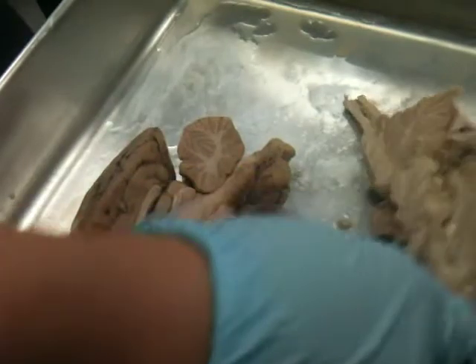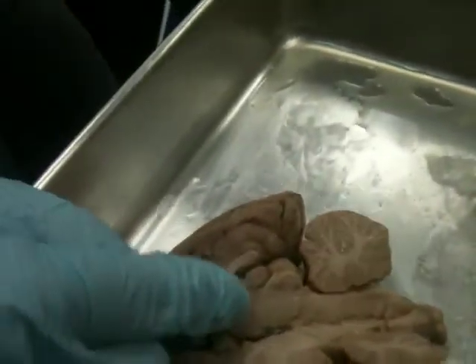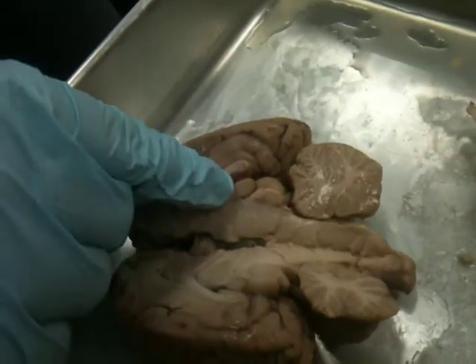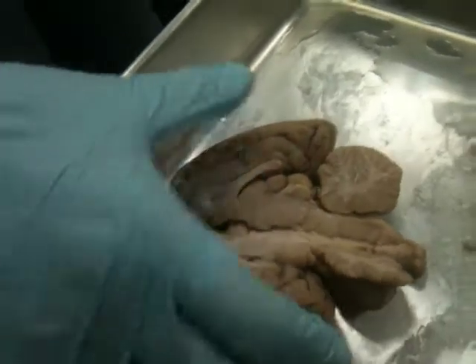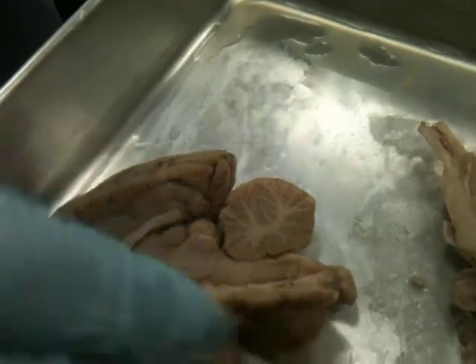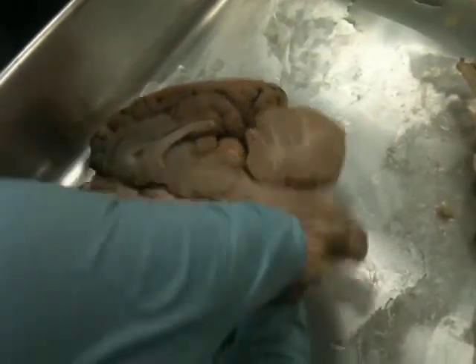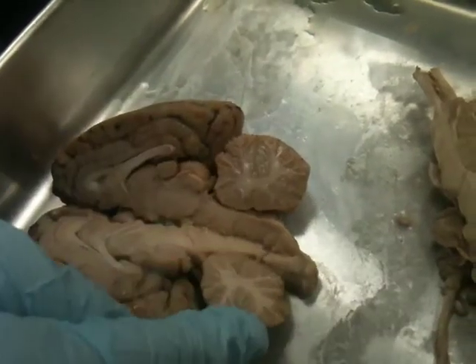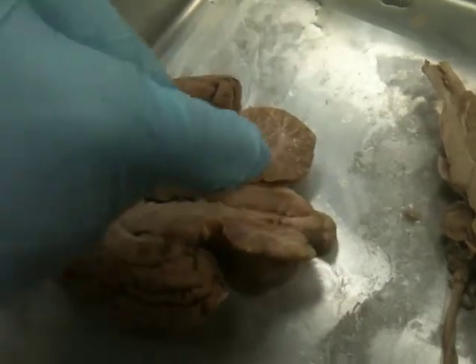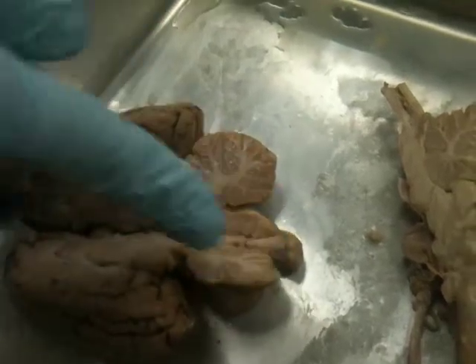So where was the pineal gland again? So the pineal gland, if you look on here, here's the thalamus. It's coming off the superior and posterior part. So it's that little flap right there. Yeah. Okay, and then again, like I said, we have the midbrain right here behind the cerebrum. And then behind the midbrain, we have this, okay, which remember was the cerebellum, and you only have to know one part of that. It's this white branching, and that's arbor vitae. Yeah, right, because it looks like a tree, so arbor means tree, tree of life.